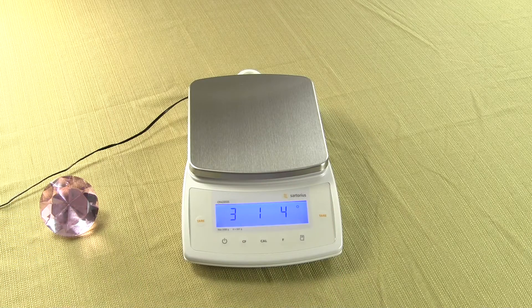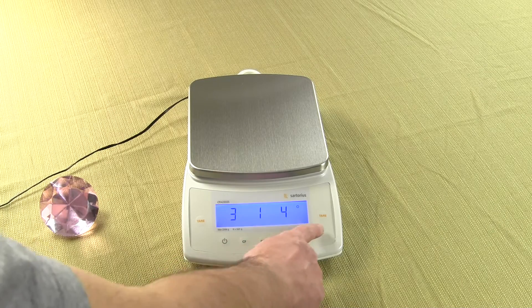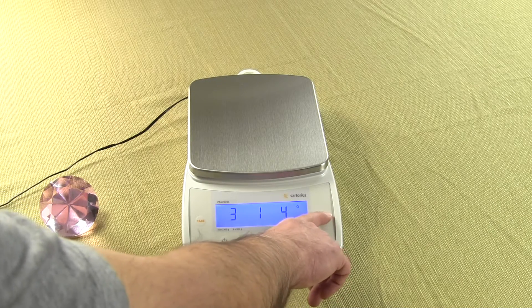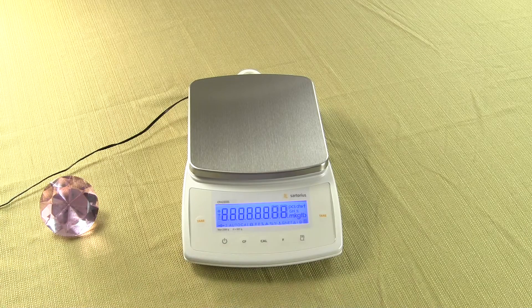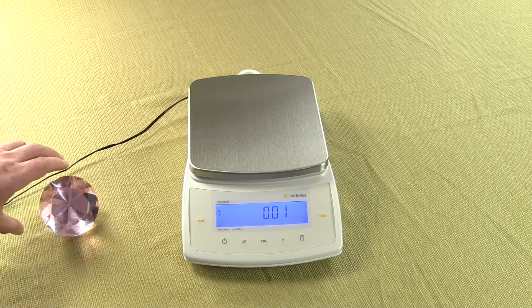Press the tare key. When you press the tare key, you see the 0 in the upper corner. We've now set that to the default, so the secondary mode will be carats. Now to reset the balance, press and hold the tare key. The balance resets and goes to 0.0.